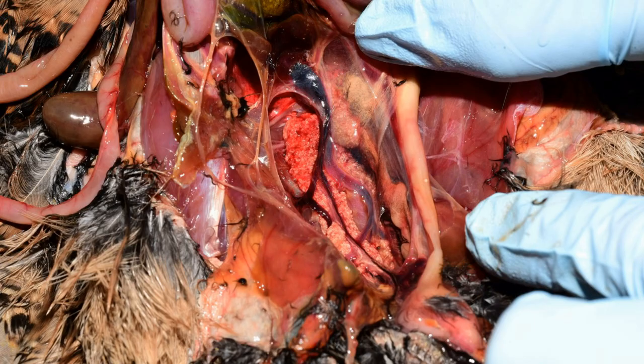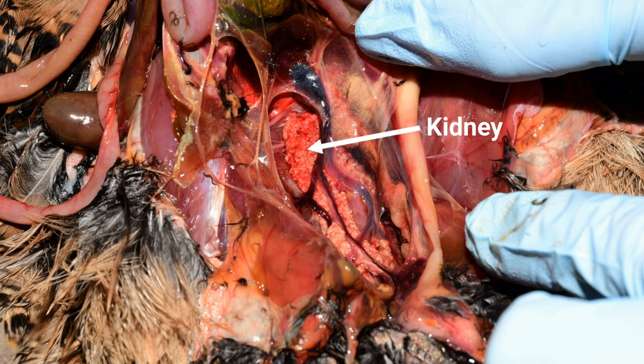The kidneys are large, compact, mostly three-lobed structures close to the spine. Their secretions flow separately into the cloaca. The renal pelvis, urinary bladder, and urethra are generally absent from most adult birds.